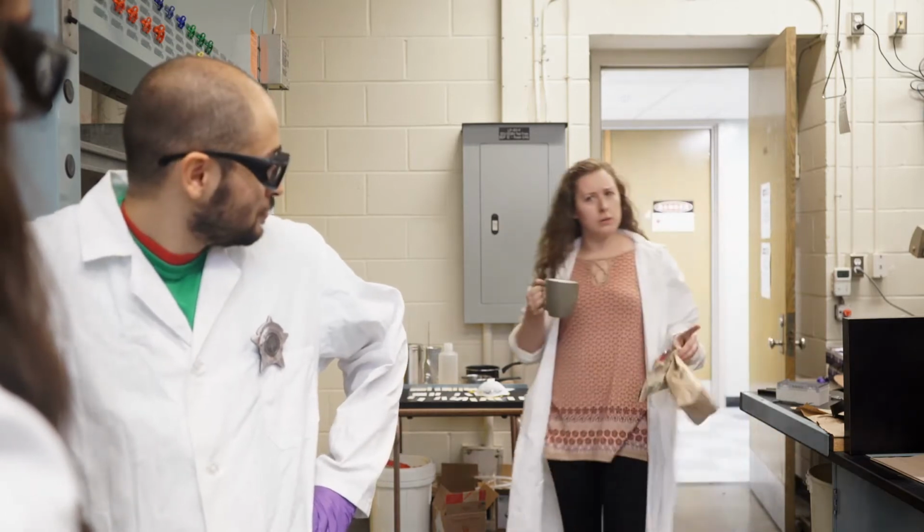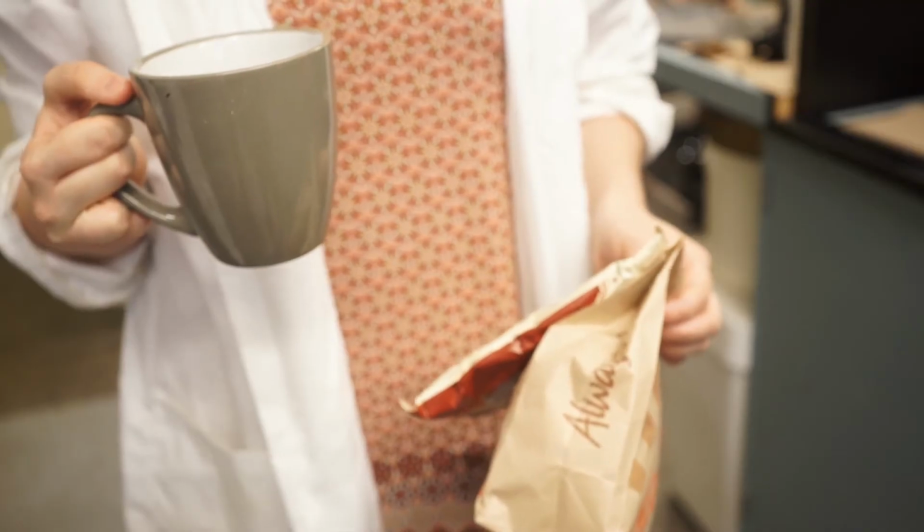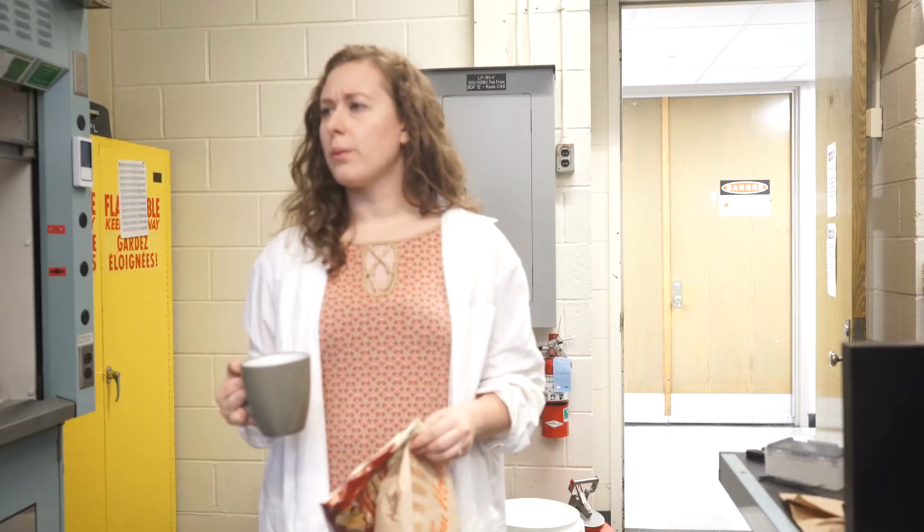Who are you two? We're detectives from the Green Chemistry Initiative. Is this your lab? Yeah. Even drinks in the lab. Another strike against green chemistry. You're coming with us.